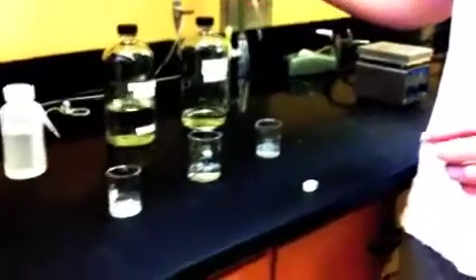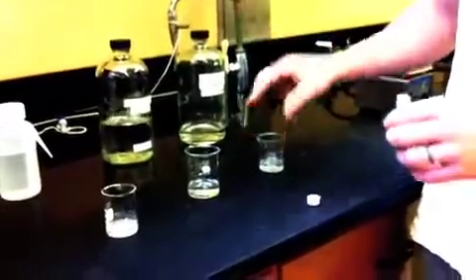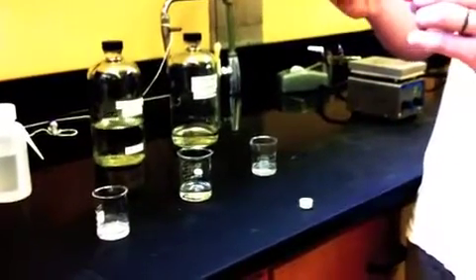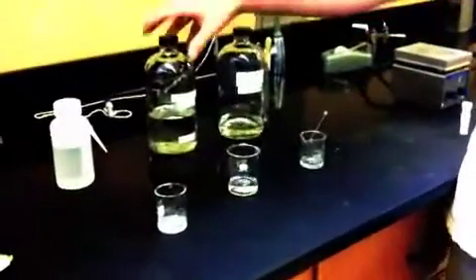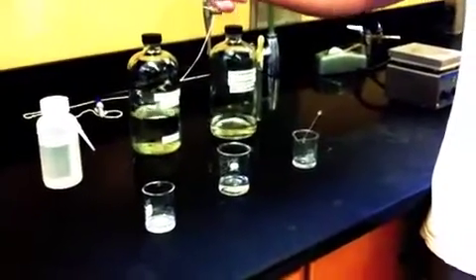So if it's ranging appropriately, this one would be sparingly soluble, that's not soluble at all, and this one would be too soluble at room temperature. So let's see if it dissolves all the way. With our ranging polarities, we can see which one is the most soluble, least soluble, and perfectly right in the middle.